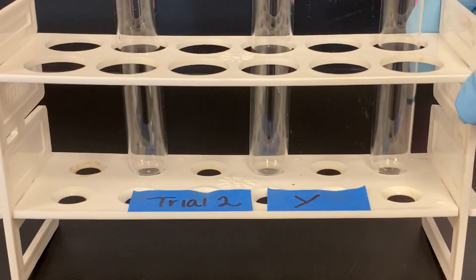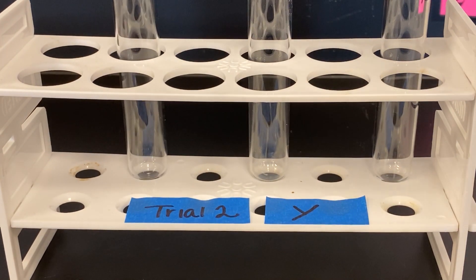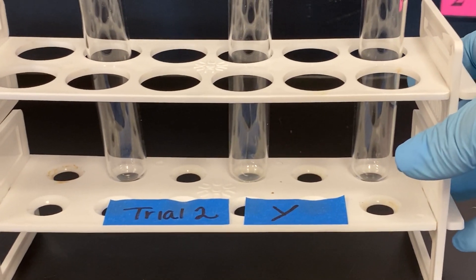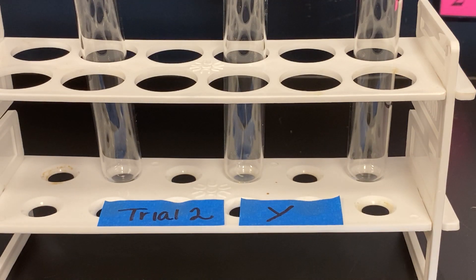Now we will begin with unknown solution Y. We will fill the base of each test tube with unknown solution Y.